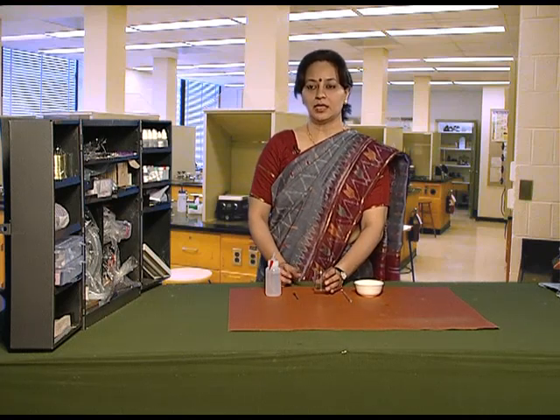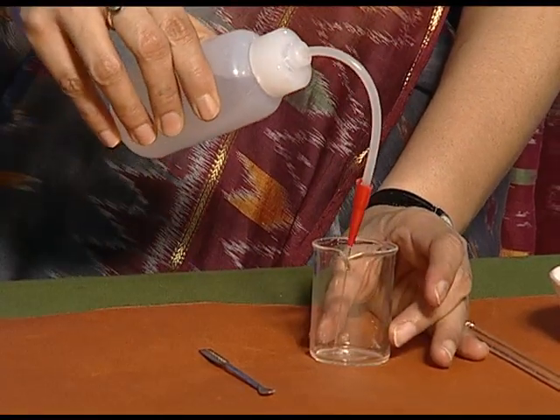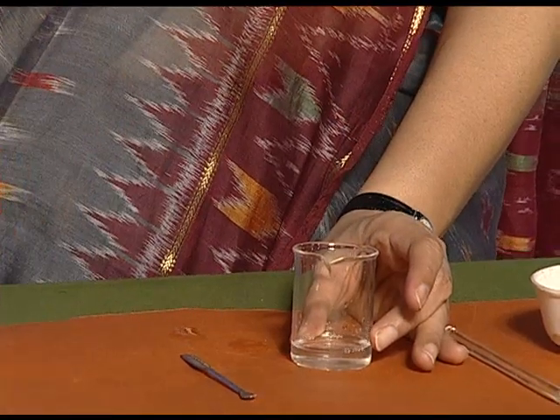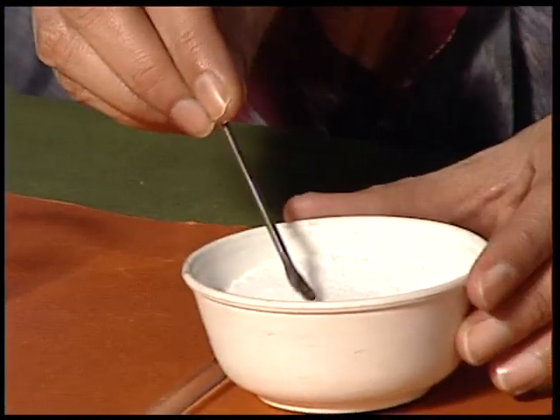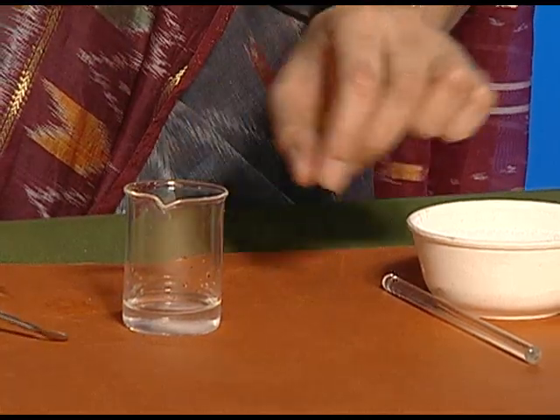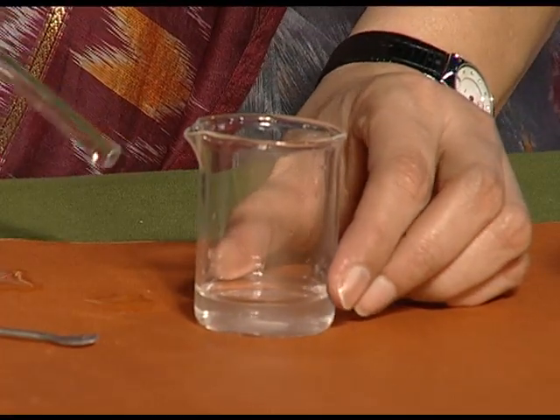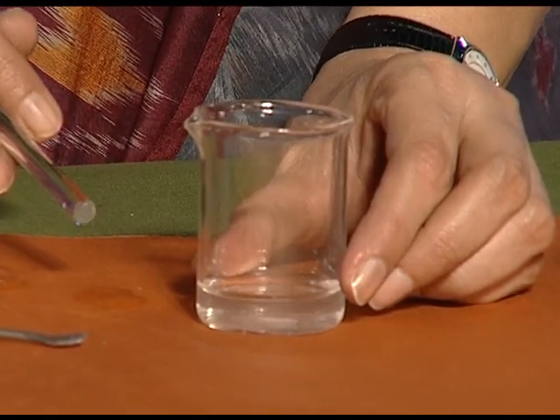First, we will take a known volume of water in the empty beaker. Take a spatula of common salt and try to dissolve it in water. We will see that the salt completely disappears and forms a clear solution.